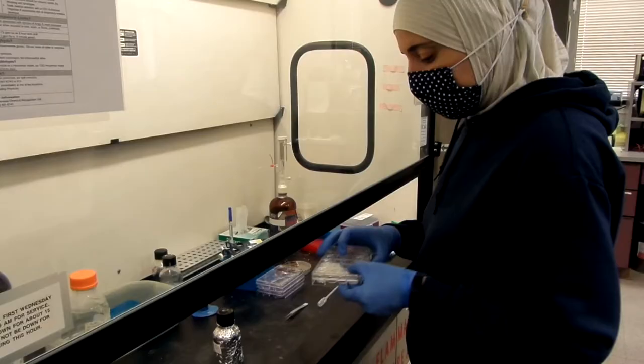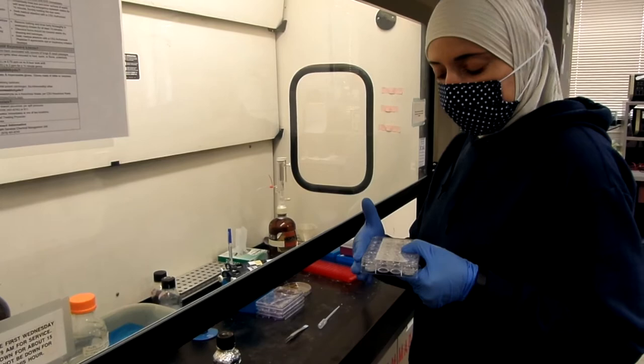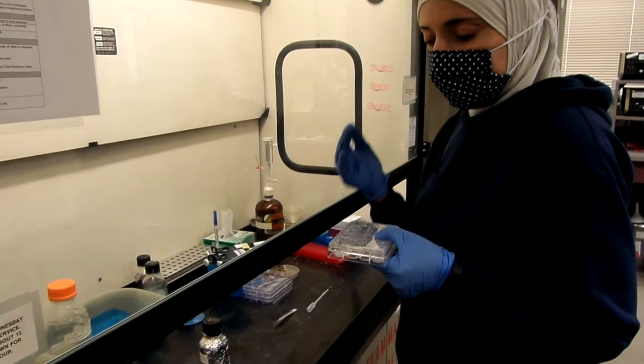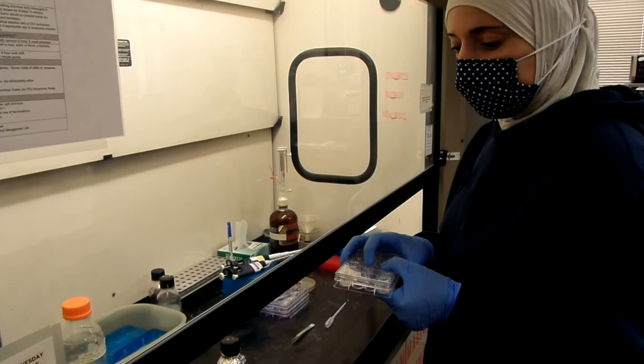The cells have been fixed in 4% paraformaldehyde for 30 minutes. And as you can see, I moved from the biosafety cabinet to the fume hood. Sterility now is not an issue. However, paraformaldehyde is a hazardous material. So, you have to work with it in a fume hood.